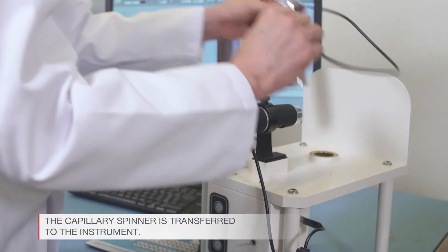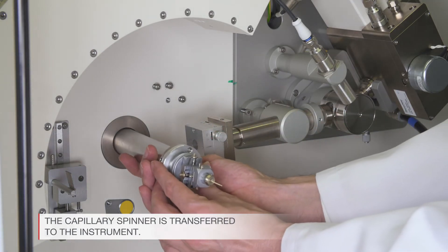The capillary spinner can easily be transferred from the alignment stage to the instrument.